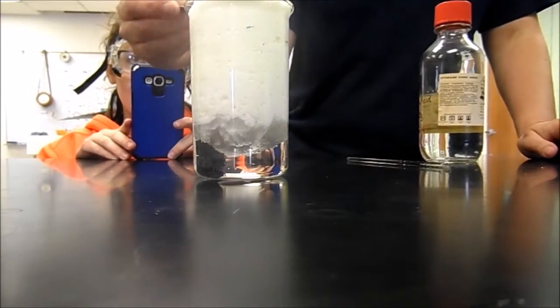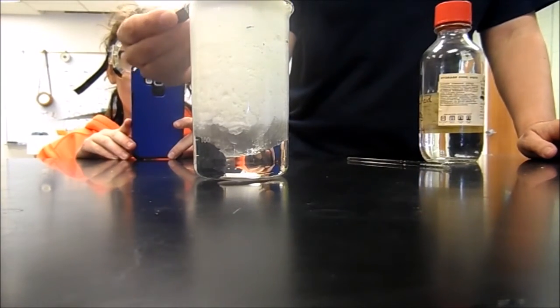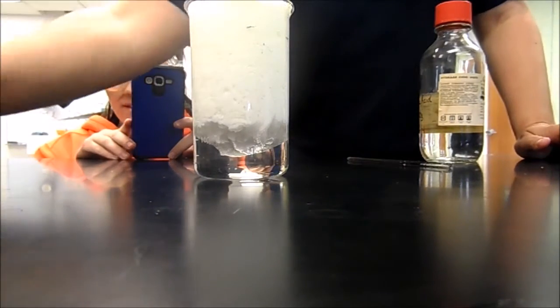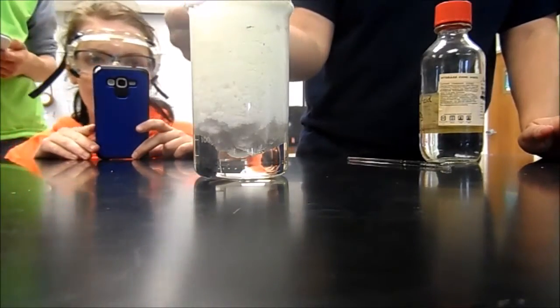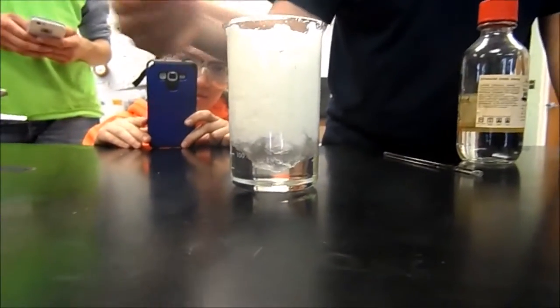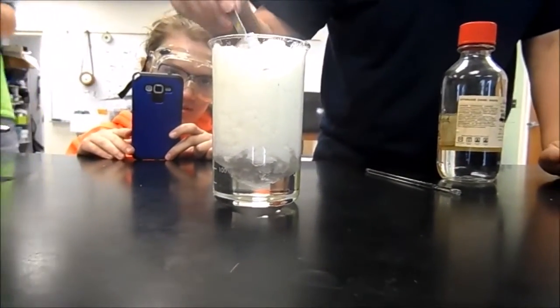Nathan's not even worried about the egg, he's just worried about the camera. It looks like meringue on a pie.